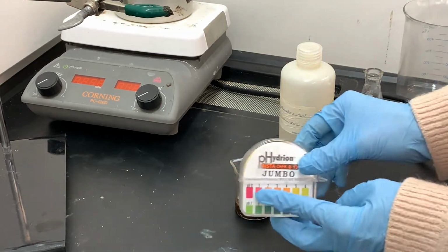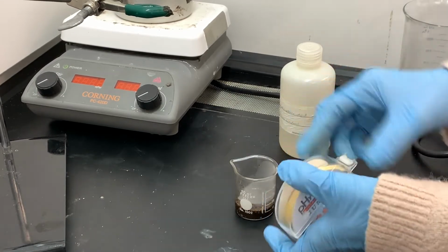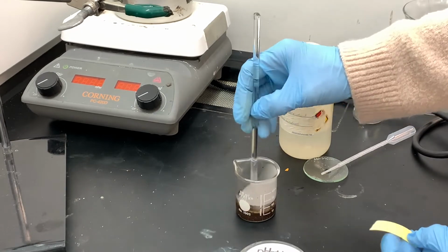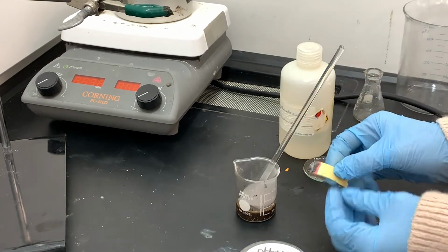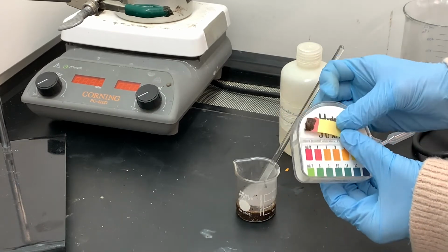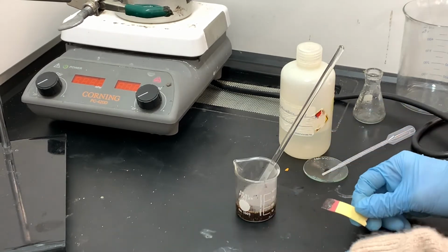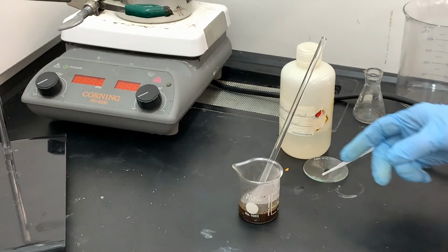So I'm going to go ahead and test the pH of this solution using pH paper. I don't know how much hydrochloric acid I should add, but I want to get the pH down to around 1 or 2, so I'm going to look for a red color. This pH testing is going to be a little bit tricky because the solution itself is colored, a really dark brown color, and that's going to be transferred to the pH paper. What I'm looking for is the color that's bleeding away from the brown clump. Look at this pink color that's bleeding away. That's the pH of the solution, so it is already really acidic. That means that step 2 is already done, and I'm ready to move on now to purification, cleaning up and isolating this product.